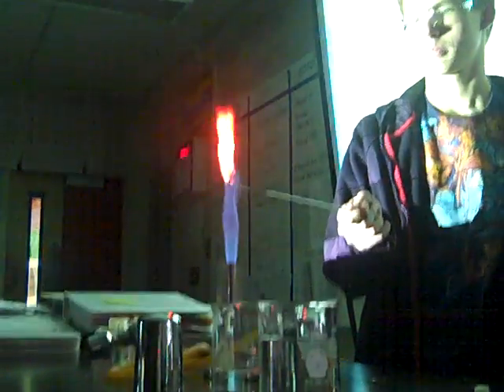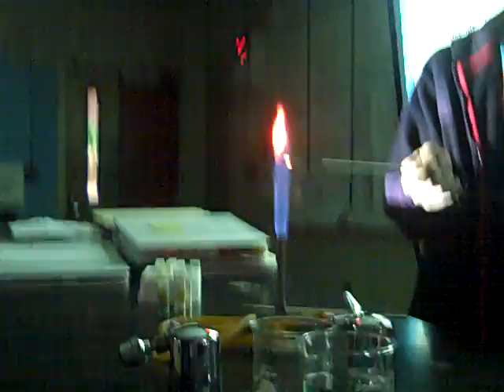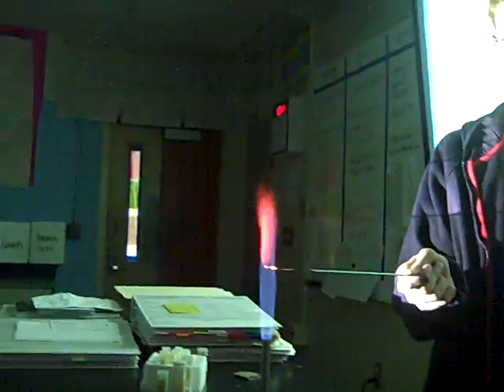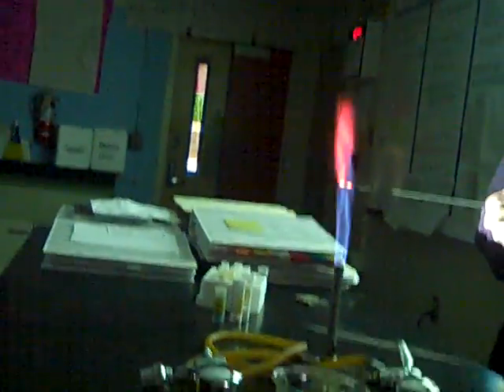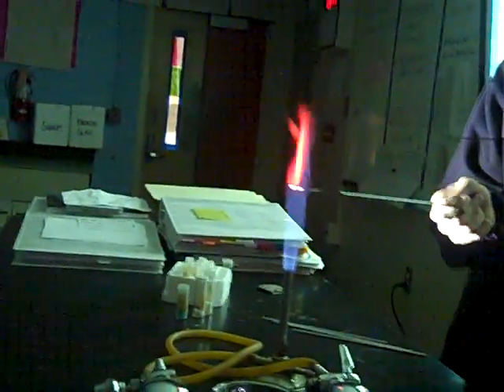Oh. Nice. Nice. That was cool. Strontium chloride. What do you guys see? That is like cherry. That is a little bit red. Yeah, it's like a cherry red. Yeah, it is really red. And it's still not finished yet.